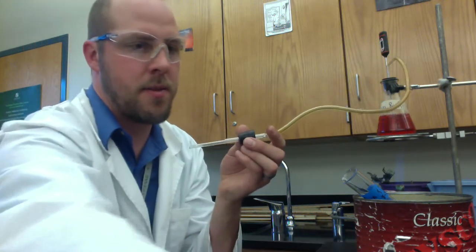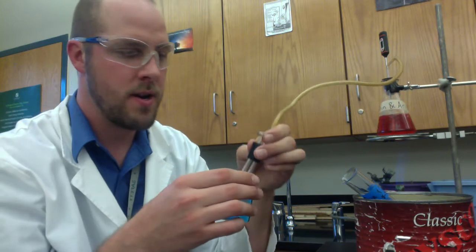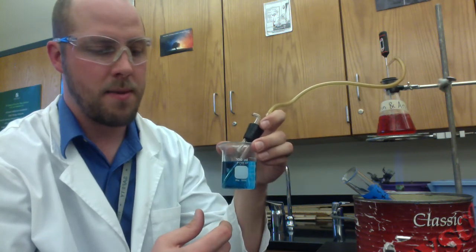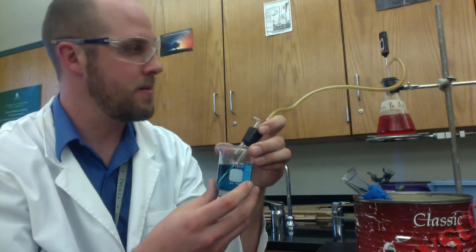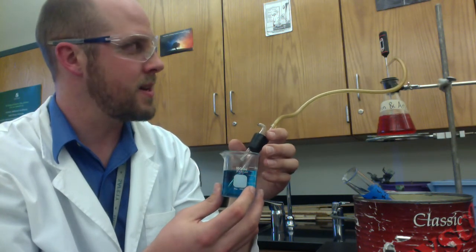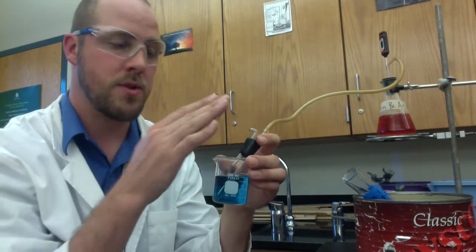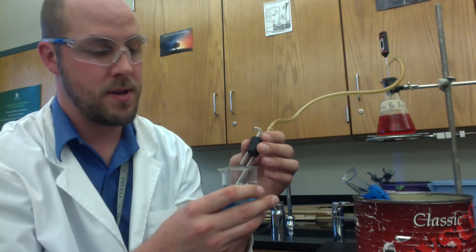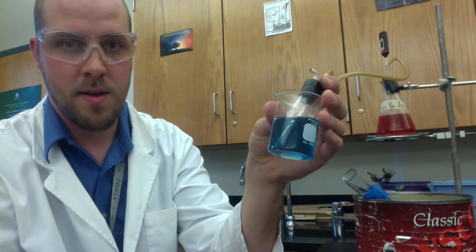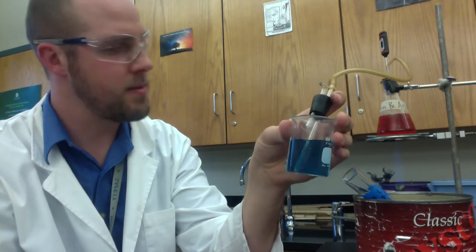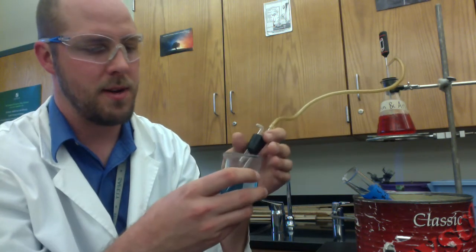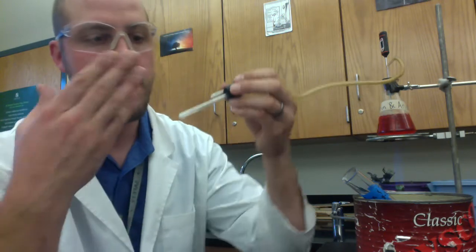After you smell it, you're going to place your reaction into the bromothymol blue and you're going to wait to see bubbles of carbon dioxide. I'll tell you how we know that the carbon dioxide is coming out by that point. But you're going to want to go kind of quickly because it will be a relatively quick transition between the temperature that the ester boils off at and the carbon dioxide boils off at. You can see some, if you watch carefully, you can see a few of the bubbles coming out of there right now. Those are likely dissolved oxygen bubbles that were in the soda. Probably a few bubbles of carbon dioxide, I'm assuming, as well. But you don't need to put that in here yet. So you're just waiting.